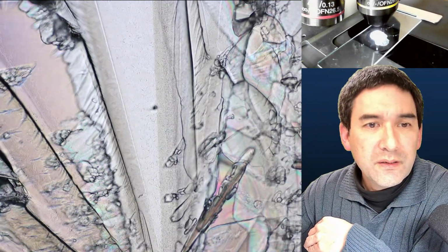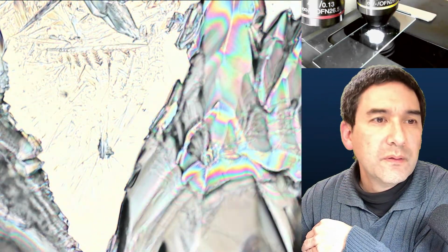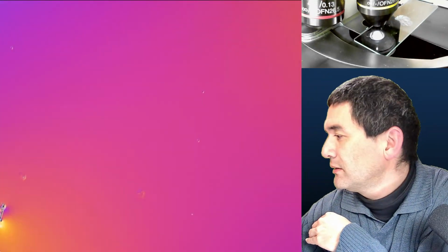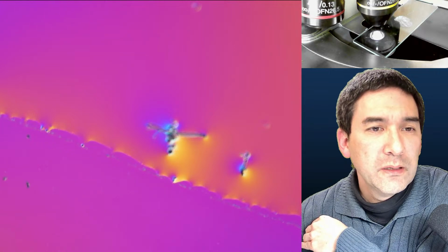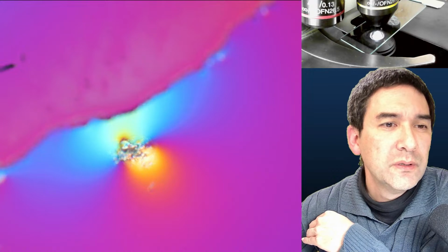Some of the crystals do look kind of similar. Also this fan-shaped appearance. Okay, let's adjust this a little bit for better contrast. And over here, this is the place where it did not crystallize yet. So you see, there's liquid there. But for whatever reason, it didn't crystallize. I don't know why. Again, maybe the substance likes to attract moisture from the air very much. But what I'm going to try now is, see here again at the borders. Normally crystallization sometimes also starts at the borders. Maybe over here or something. I don't know.